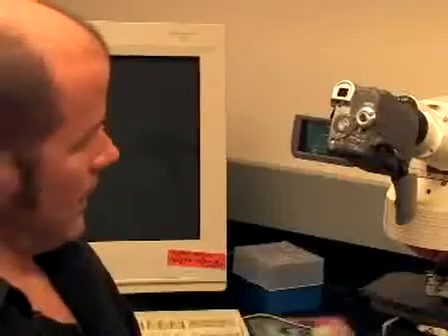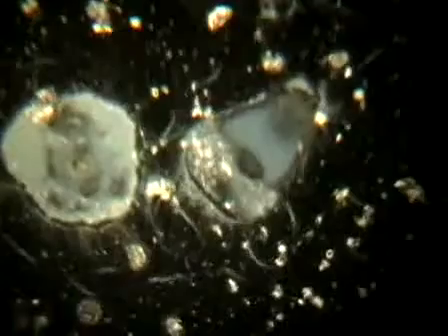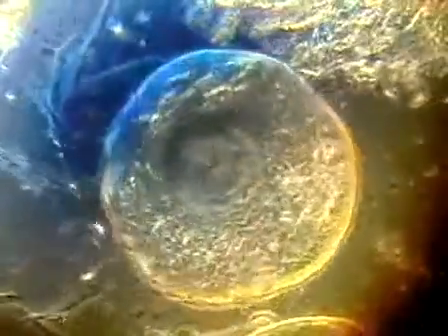Well, there are different ways of looking at these microbes by light microscopy. We have, with this microscope, the capacity to do dark field microscopy, where cells will appear white or be outlined in white with a dark background. We can do phase contrast microscopy, where cells or edges of cells will be dark on a gray background. We can do regular light microscopy, where you don't see much of anything unless the sample is colored, but you'll get the real color of the sample. So if your sample is green or red, you may actually see that in the cells.